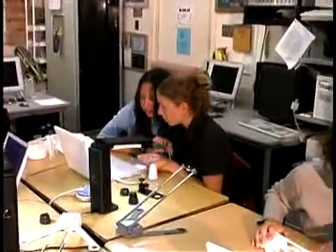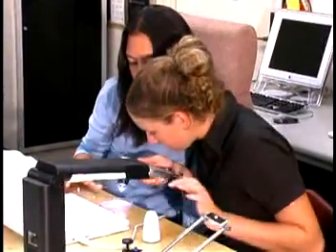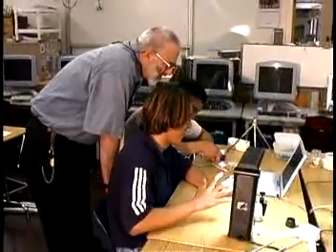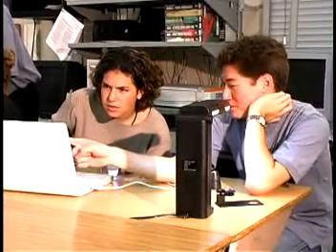A microscope is just another tool. It's another resource. Just like the computer, just like your textbook, the microscope allows us to expand our vision. The more resources you bring into your classroom, the more successful you will be at teaching that topic. Handheld allows you flexibility. It allows you to move around. It allows the students to be a little bit more creative.